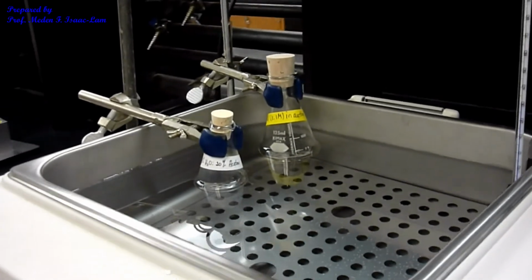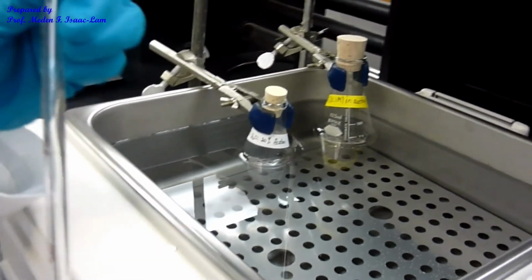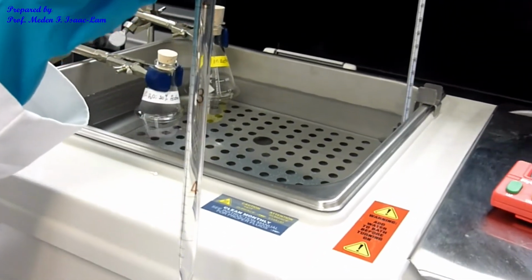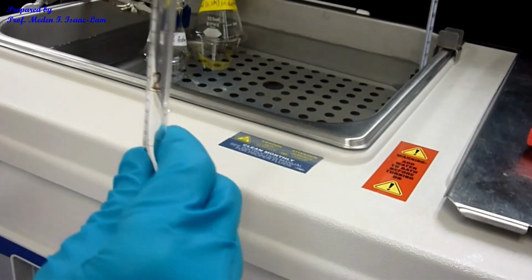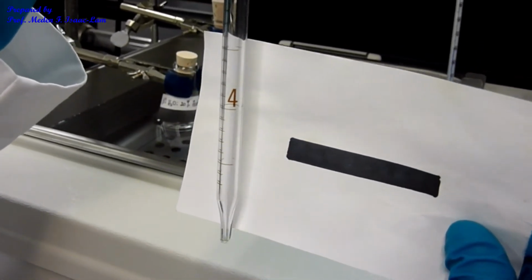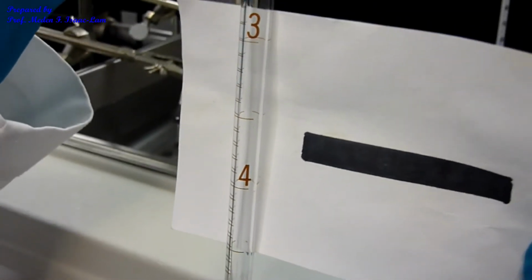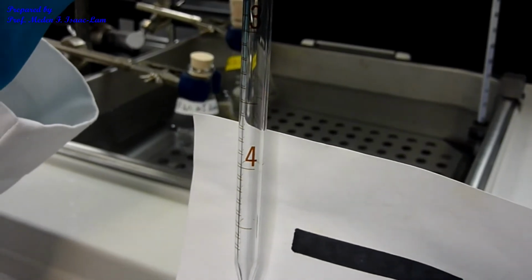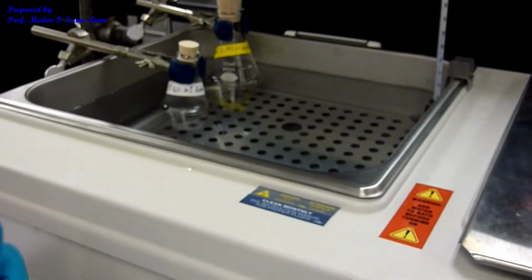Okay, so as a note, I'm using a slightly different pipette. So this pipette is to deliver. So as you can see, compared to the previous pipette, if I pipette 2 mL, I can go up to 3, and then I deliver up to the tip 2 mL. Okay, so I'm going to use this one.